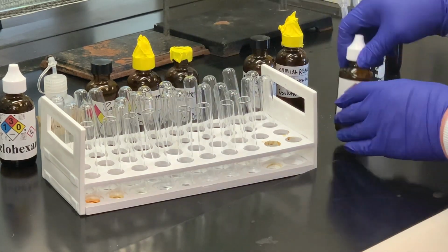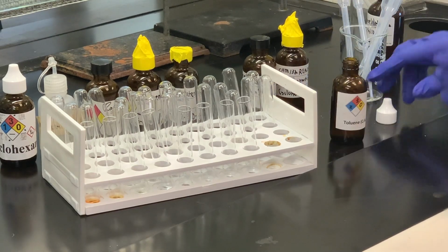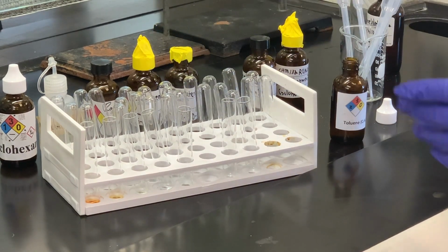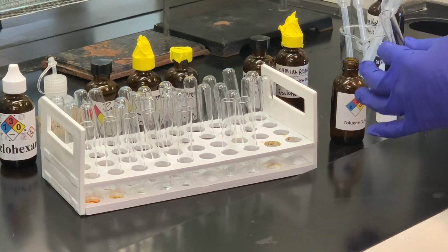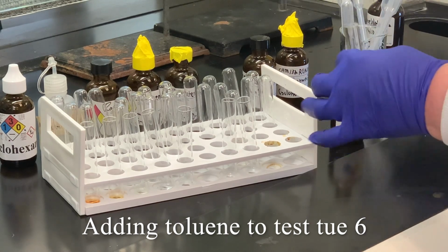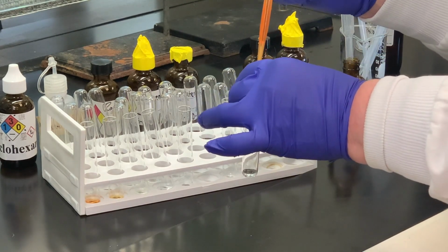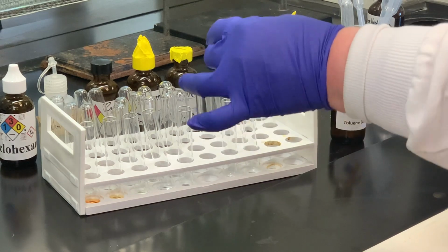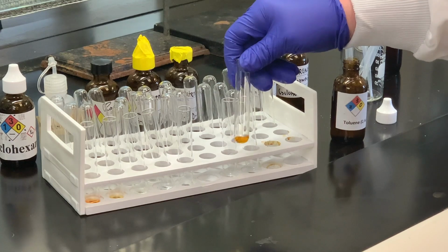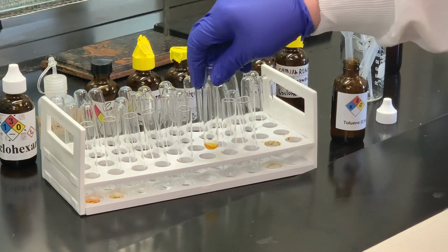Next compound is toluene, and toluene is an aromatic compound. It looks just like benzene, except the methyl group has substituted one of the hydrogens on the ring. So based on what we said earlier about benzene, we would expect nothing should happen here. So we've got our solution there of toluene, a couple drops of the bromine, and as you can see, that orange color has not changed, which is what we would expect for an aromatic compound, so no reaction there.